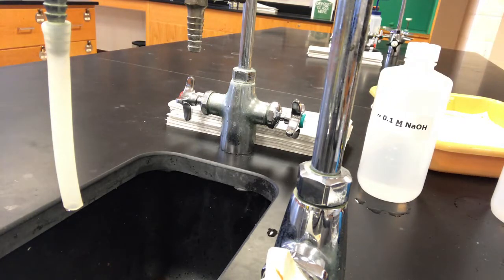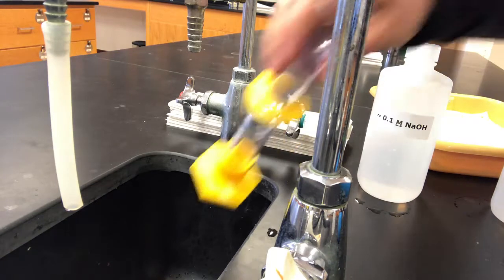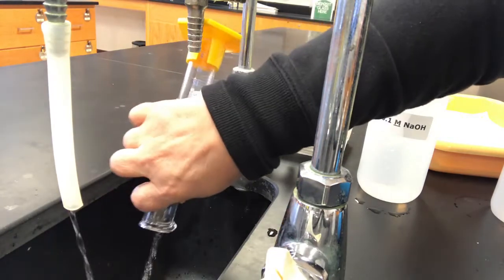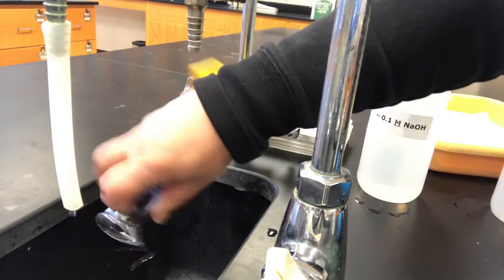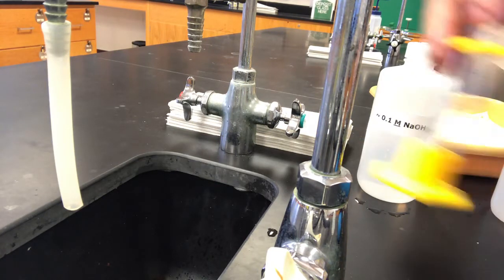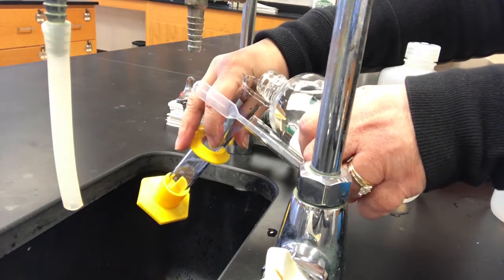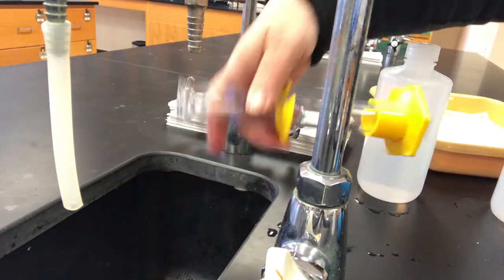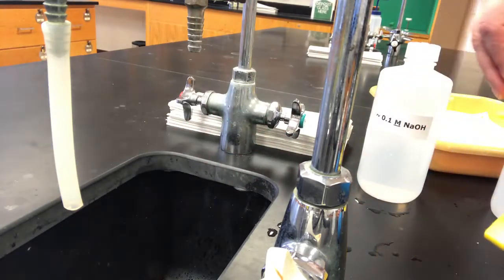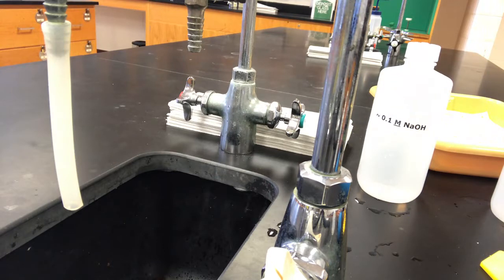Likewise, we'll take some hydrochloric acid and you have to calculate. First we'll rinse out. I'm going to use the same graduated cylinder, so I should rinse it out. If I'm being very careful, I'd want to also rinse it out with the hydrochloric acid solution before I use a different solution. So okay, why not? Let's be careful. Again, the actual concentrations I'm mixing are not going to be super important that they have to be exact, because we are going to measure with a good deal of precision what they actually are.